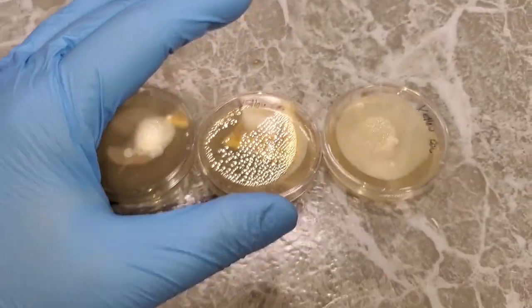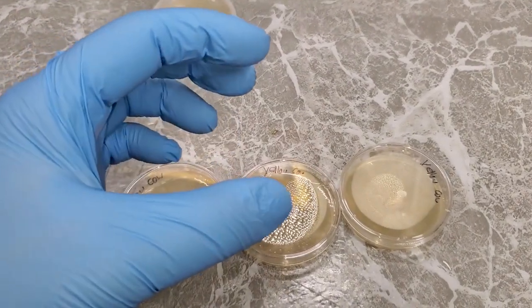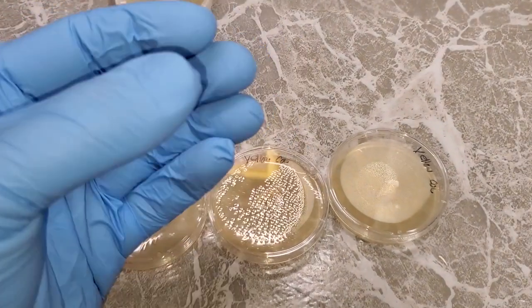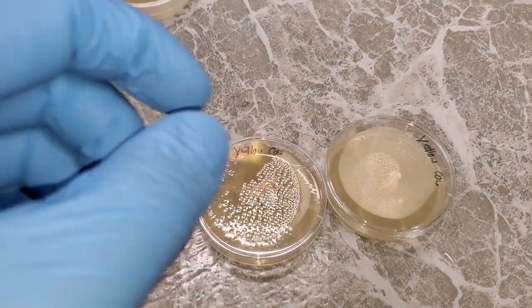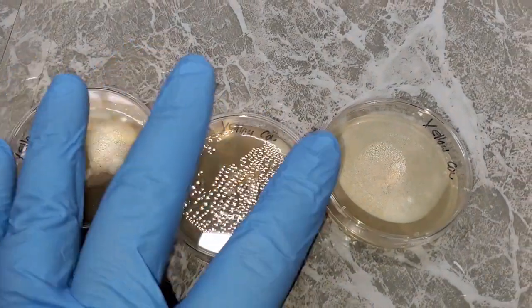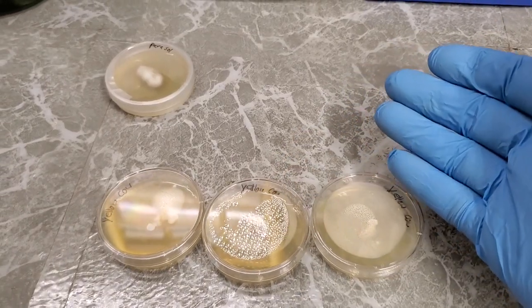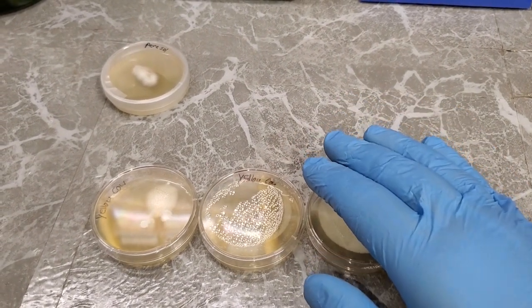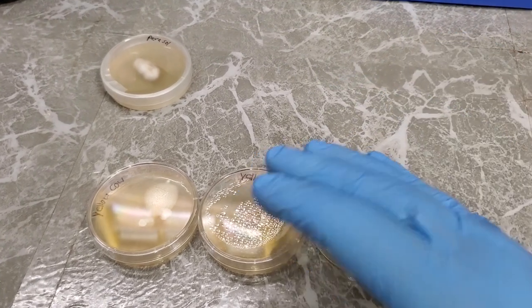Even if you do everything properly, even if you take all the proper precautions, even if you, like I said in my video about cloning a white button mushroom, break the fruit body in half instead of cutting it, and take a scoop of the tissue culture from the middle of the fruit body and put it onto agar, chances are whenever you're dealing with a wild mushroom that has an unknown lifestyle that it led, I guess is the best way to put it, there's a whole lot of variables out in nature that you just can't really take into consideration until you are forced to deal with that variable.